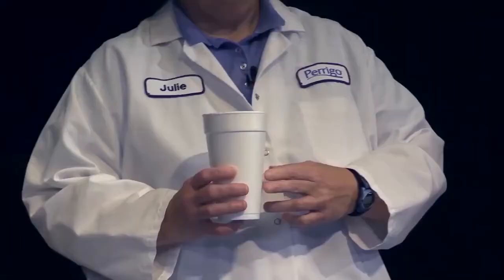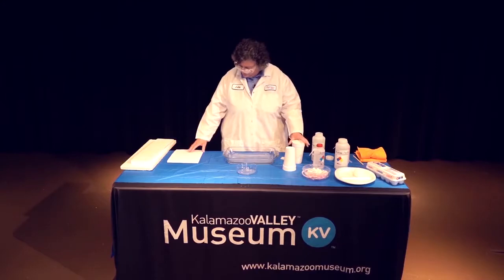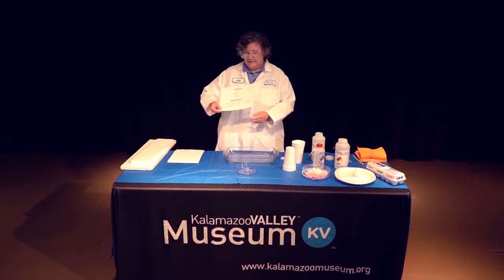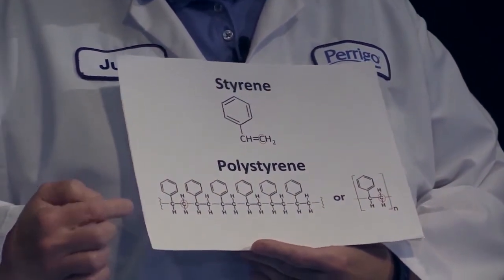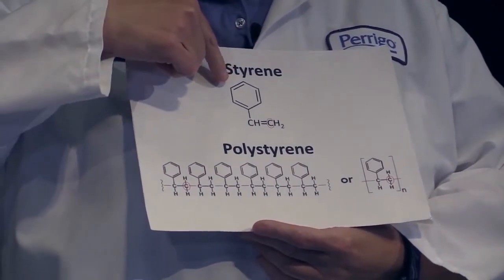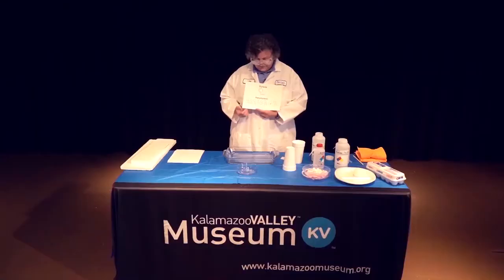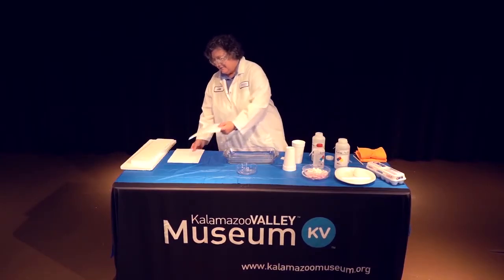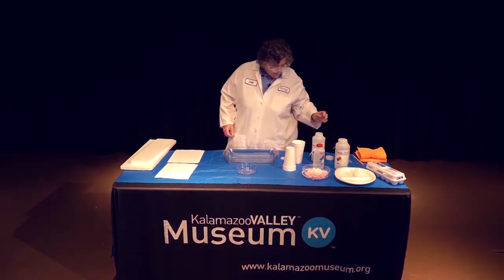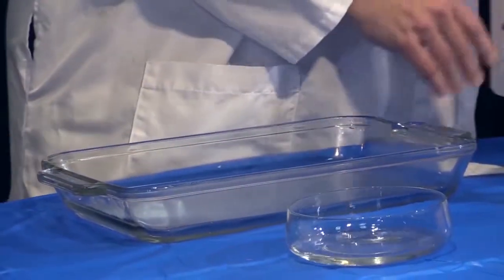What we're going to do today is we're going to talk about what makes up Styrofoam, and then we're going to dissolve it. So Styrofoam is made up of a material called polystyrene. Polystyrene, poly meaning many, has many styrene molecules connected together into a big long chain. And that is what Styrofoam is made up of, all these styrene molecules. So we're going to disrupt this Styrofoam and dissolve it and see how much air is actually in this cup.